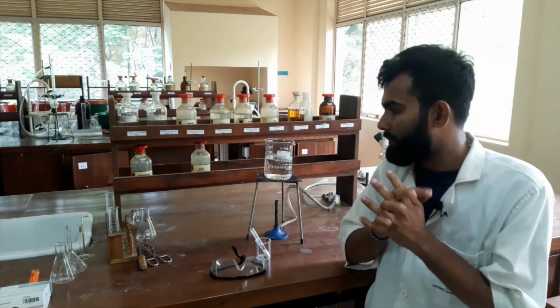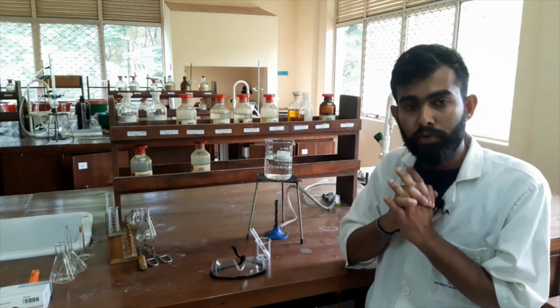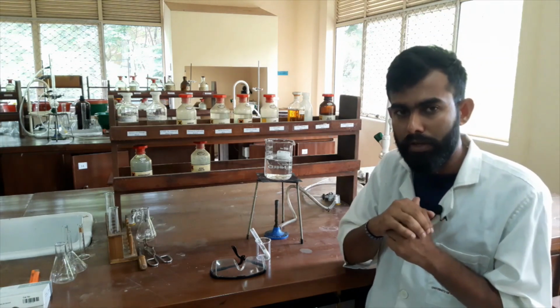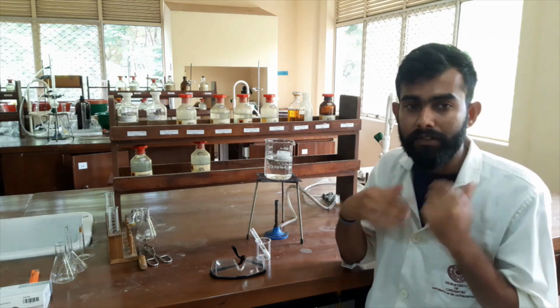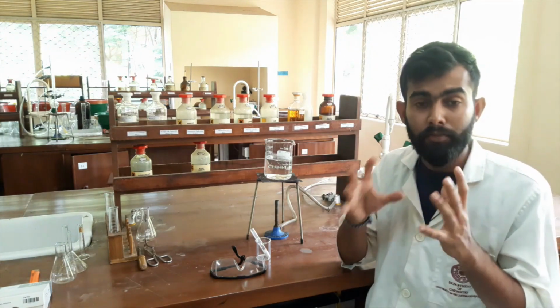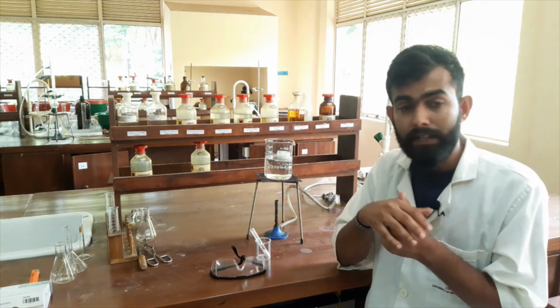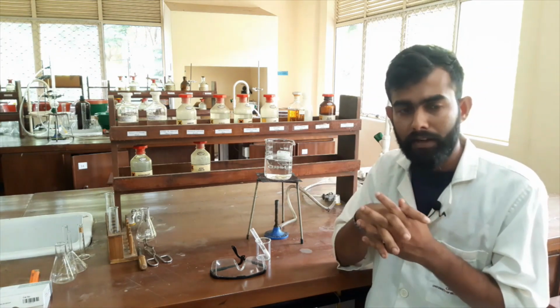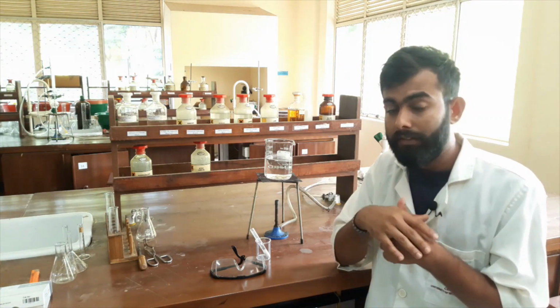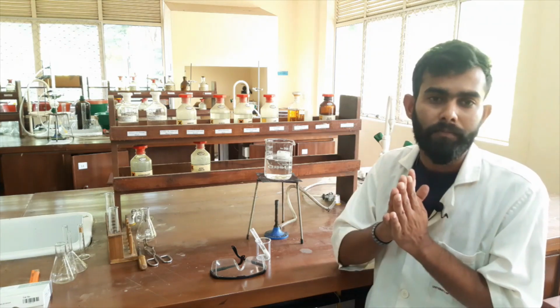The first trial, the first solvent, should always be distilled water. In every situation in recrystallization, we will start our experiment with distilled water because it is very cheap, inexpensive, and readily available. There are so many benefits to using this distilled water. Because of that, we start our experiment with distilled water.